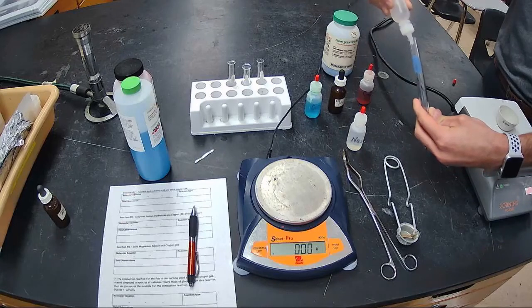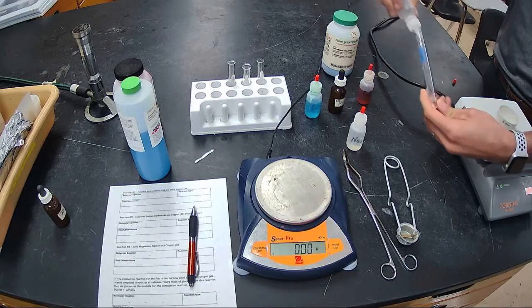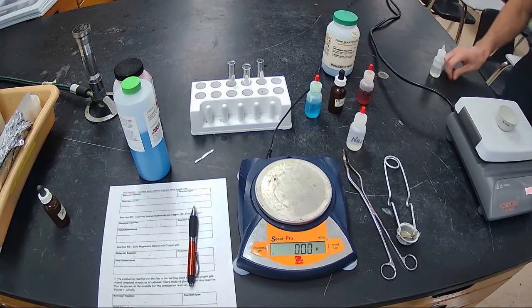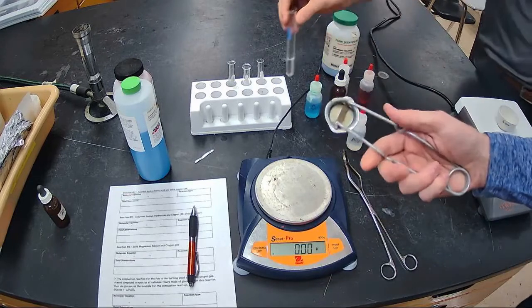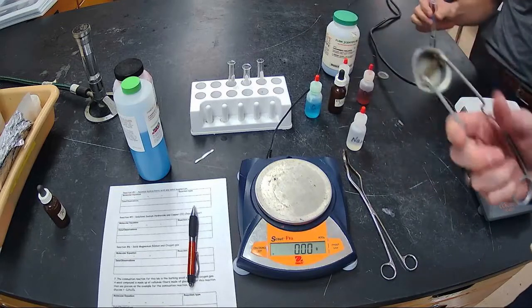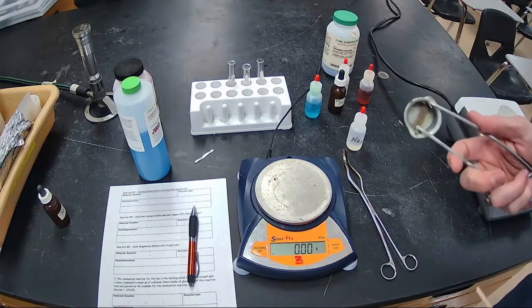So Ms. Furiosi's filling that up. We'll fill it, probably give it a little bit more. We'll do about a good amount. There we go. Say when. Yeah, say when. So there we go. If we're going to drop it in there, we have to turn on our gas. And we're going to use our striker. For those of you who have already seen a striker before, that gives you a little spark here. We're going to turn on our gas and we're going to get ready to light our wooden splint.